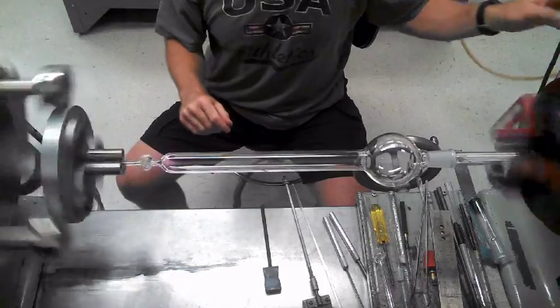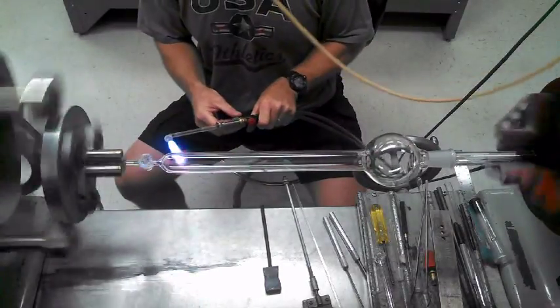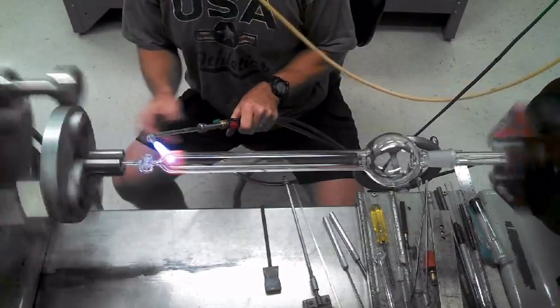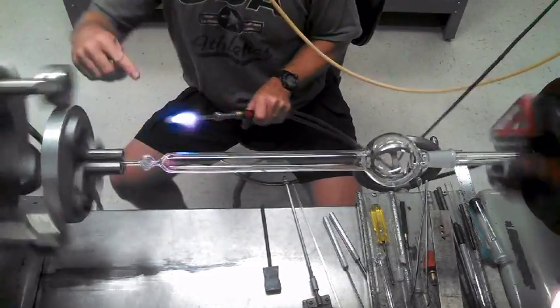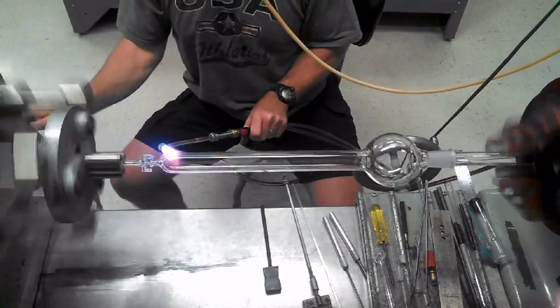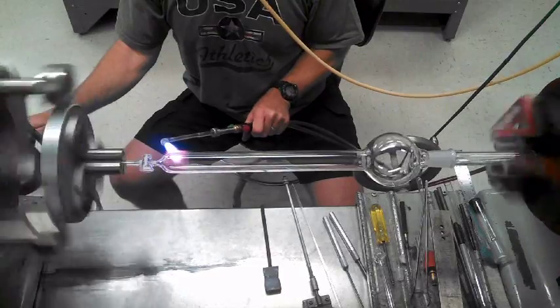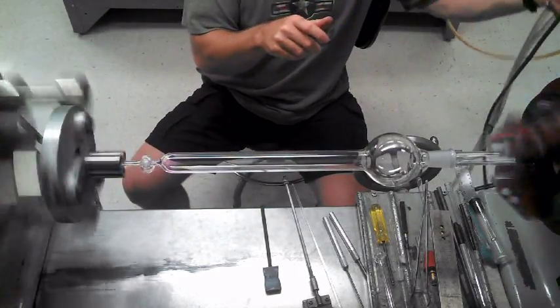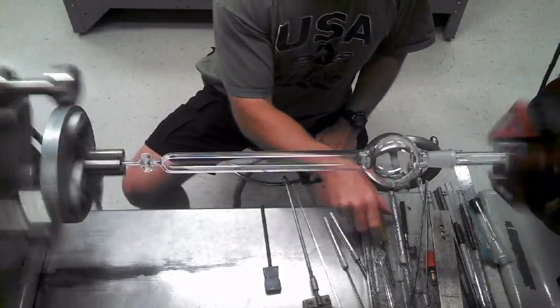I really don't anneal that, but I'll do it for the person I'm showing. I'll heat up the whole thing a little bit. Take a distance, use the four-plus flame here. A little blow — that's fine. Hold that hard enough a second.